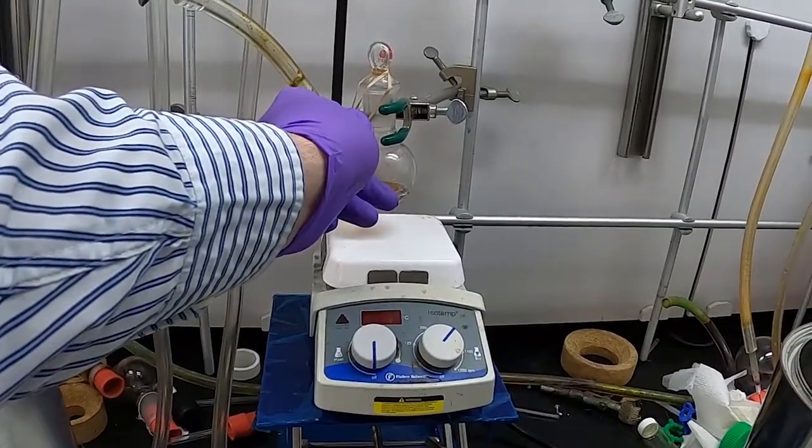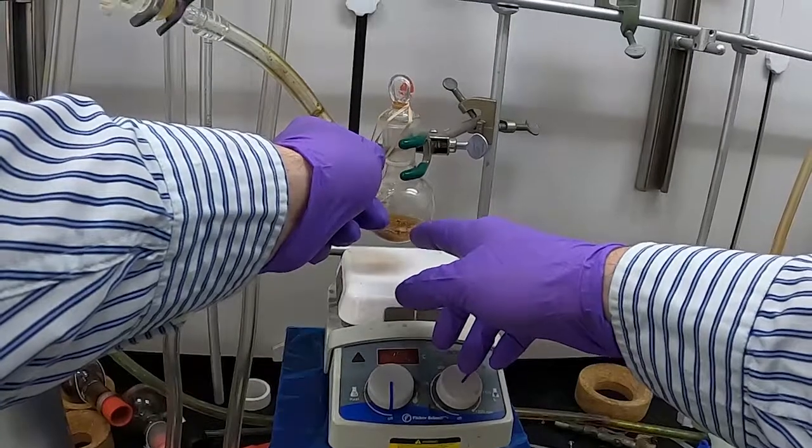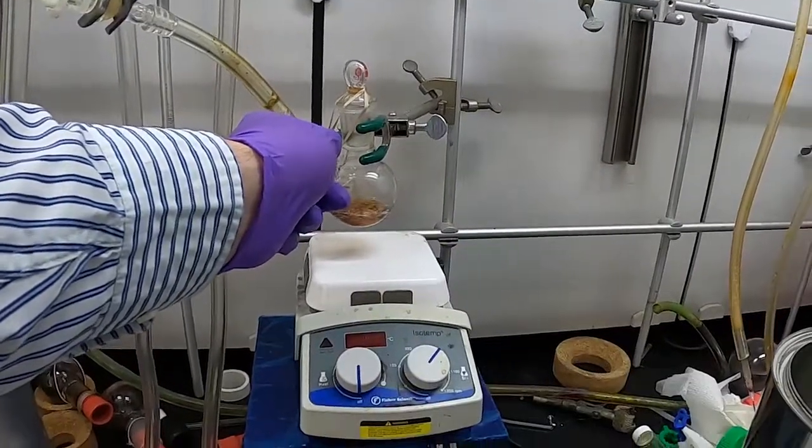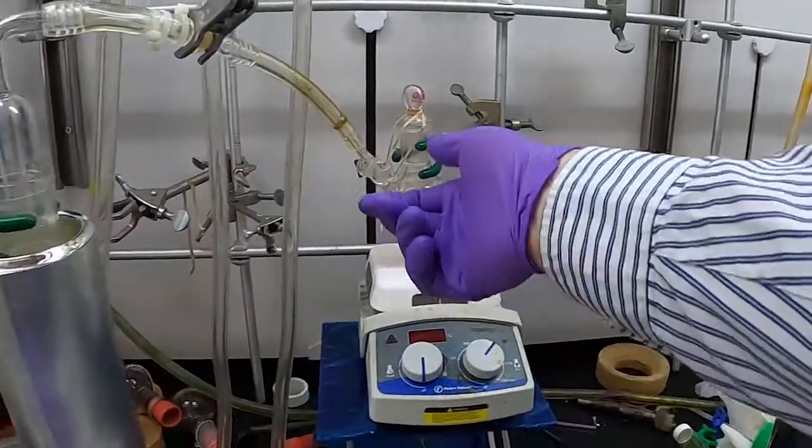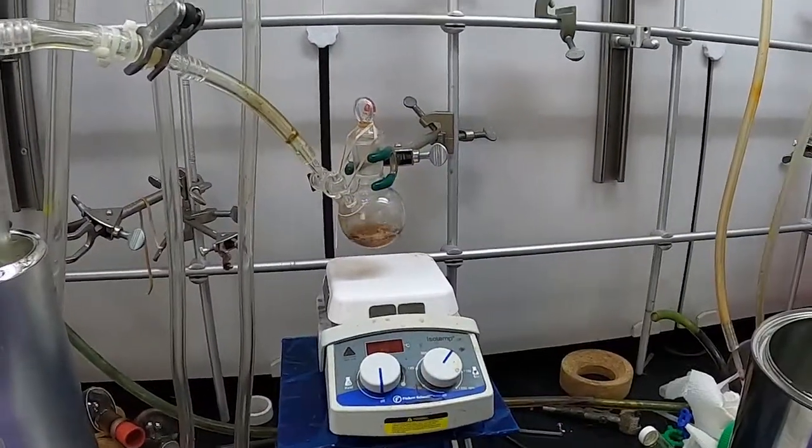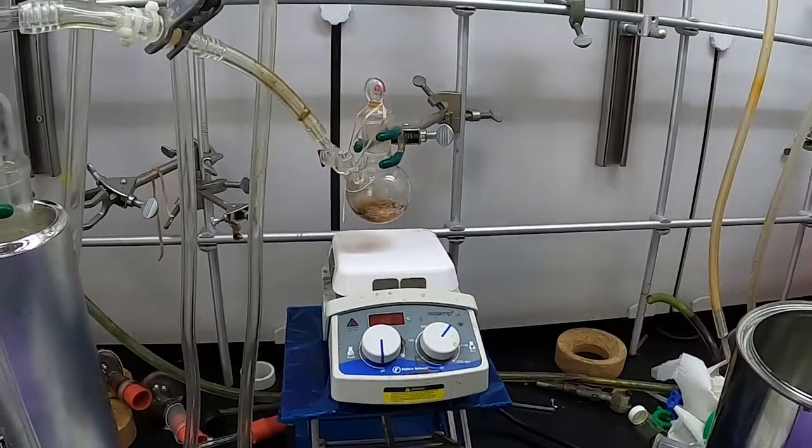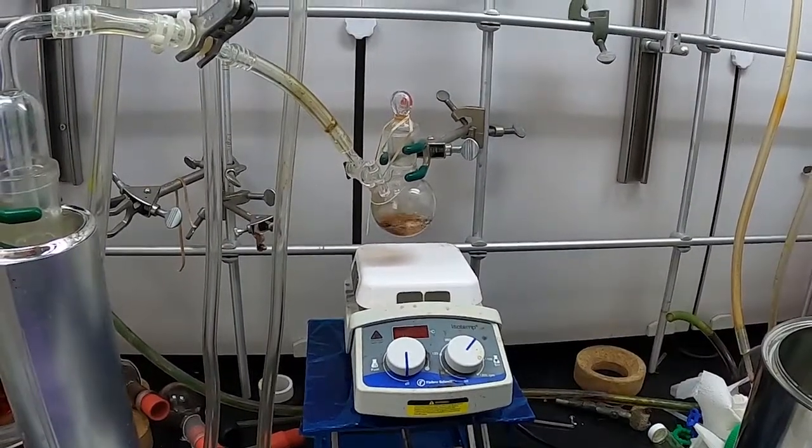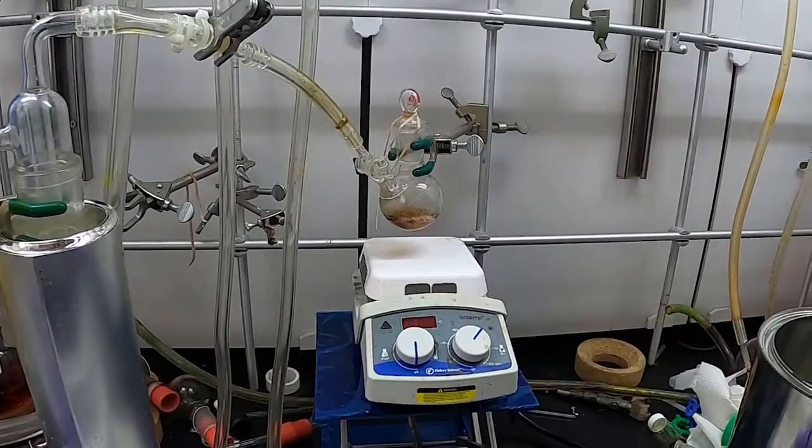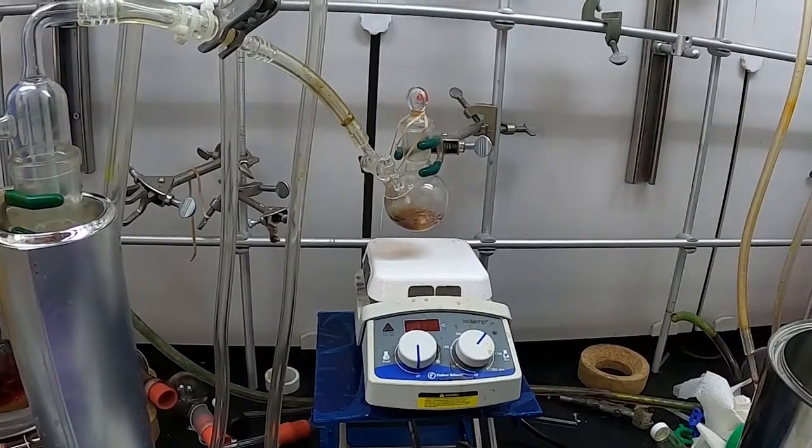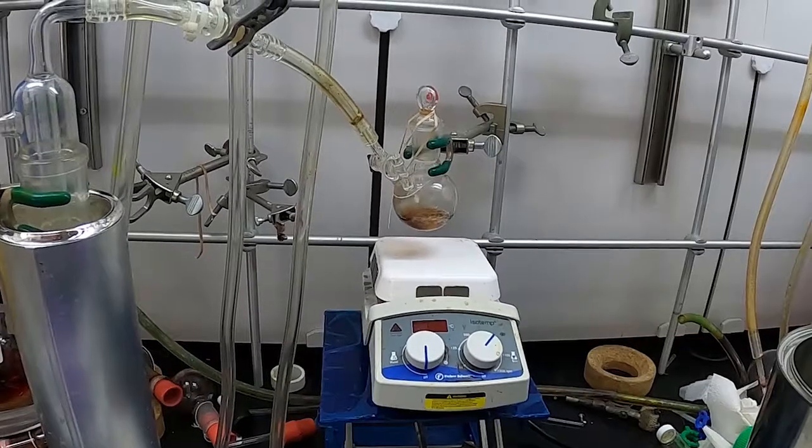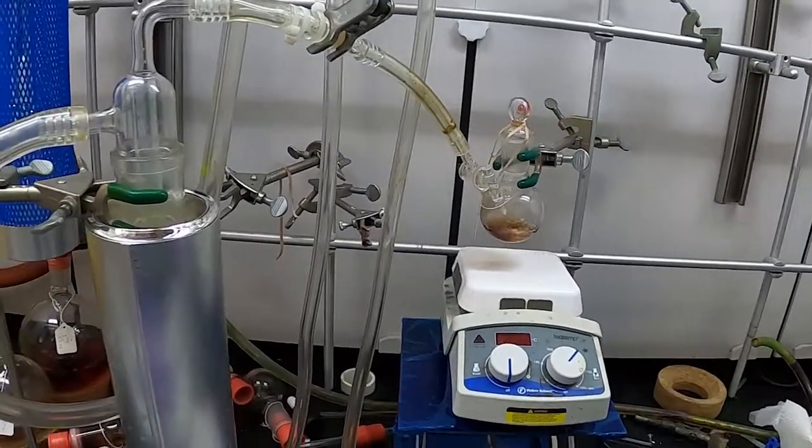You can see the bubbles start to show up there a little bit. Then you can open it all the way when you're ready, or if you need to, you can slowly open it and let it go there. Then you rapidly let it go until you're pumping down. I'll let this continue until we're ready to shut off our flask, and I'll show you how to take this apart.